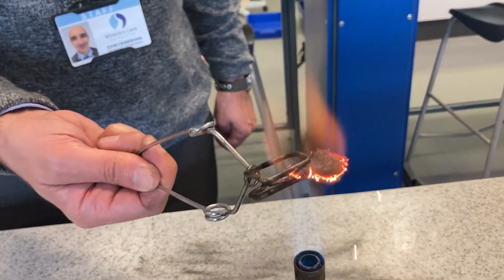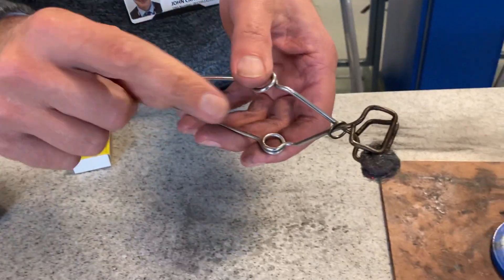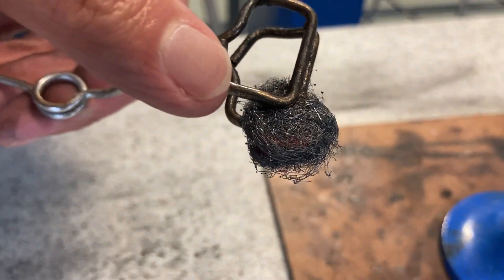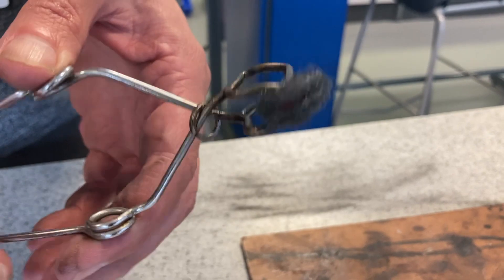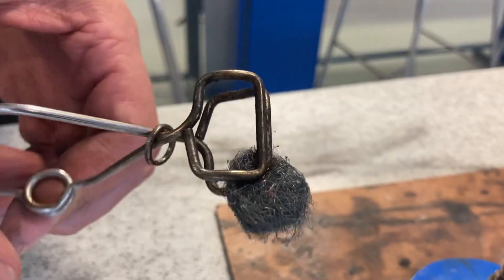That's not bad — it sort of glows, we've got a few sparks coming off it. But actually, if I take that away, can you see? Most of it's not really reacted. That's not reacted at all. Slight orange glow in there — can I see something's going on maybe? But not a lot.